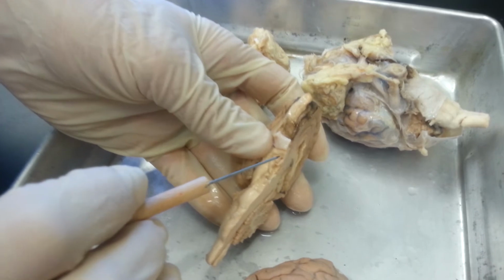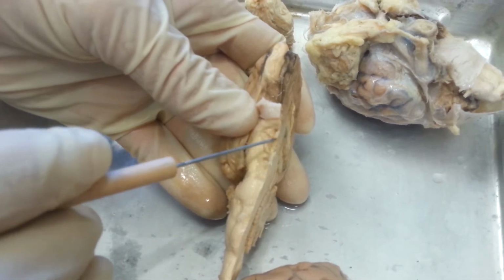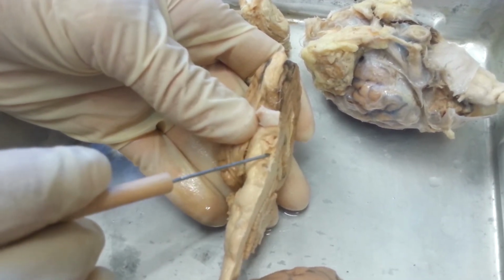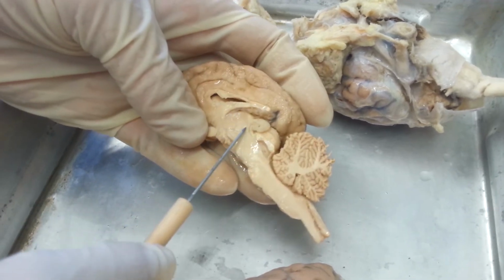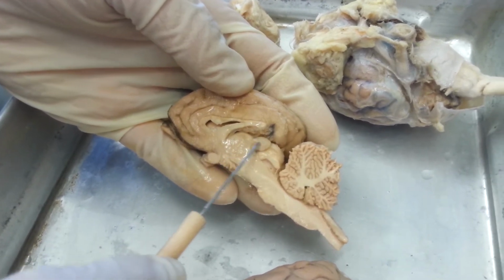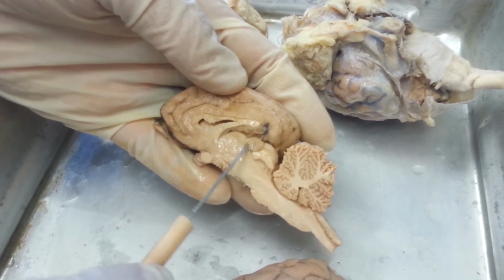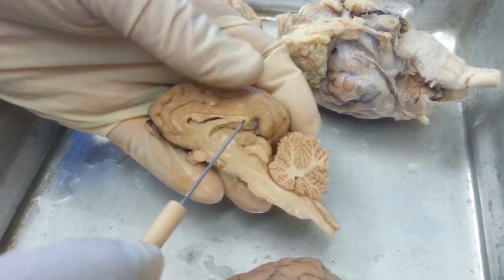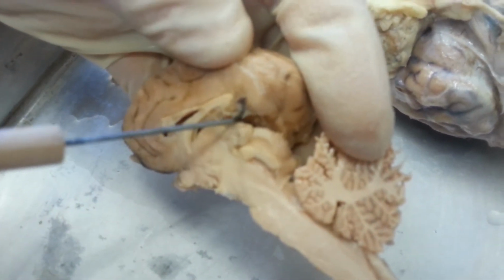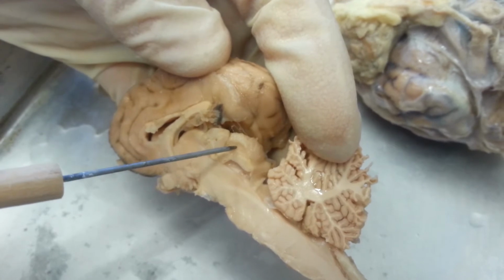Alright, this has the pituitary gland removed, but the infundibulum would be right there. Below the infundibulum are two raised portions called the mammillary bodies. We showed you the thalamus before, and the hypothalamus. The epithalamus is the roof of the thalamus, and it includes this structure. The pineal gland is part of the epithalamus. Also the tela choroidea, which is this kind of spider web connecting tissue between your cerebral hemisphere and the corpora quadrigemina. We'll get to that in a second.